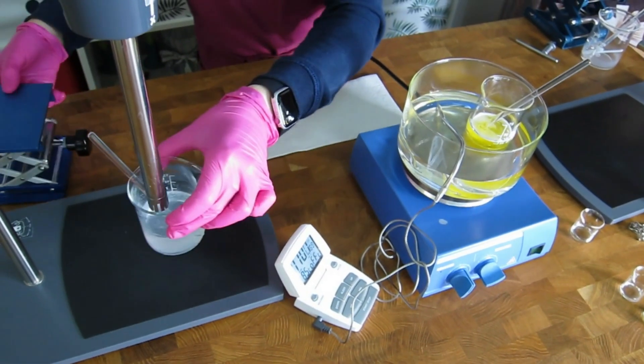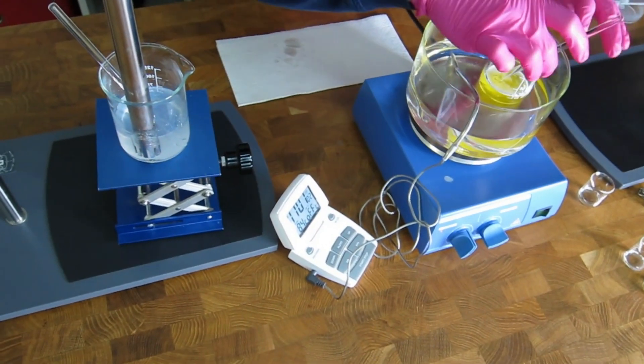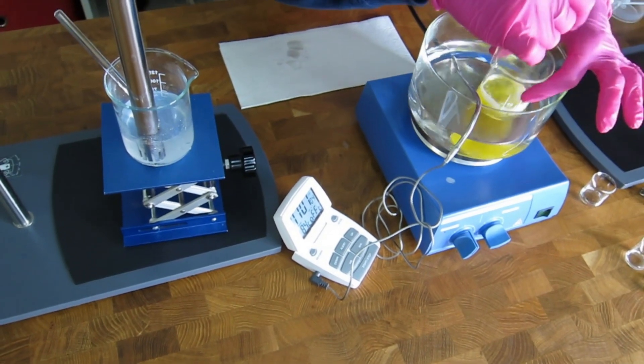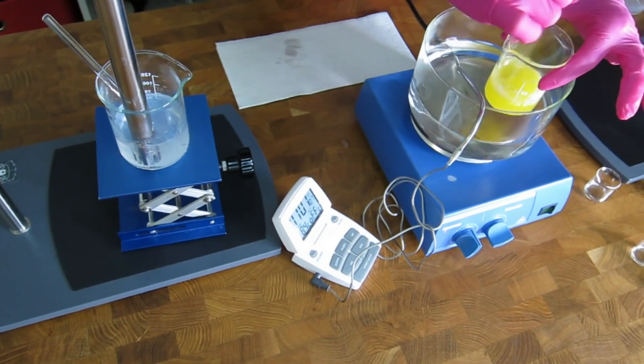Now we remove them from the bath and homogenize the oil phase in the water phase.